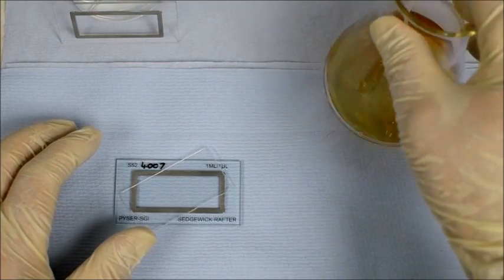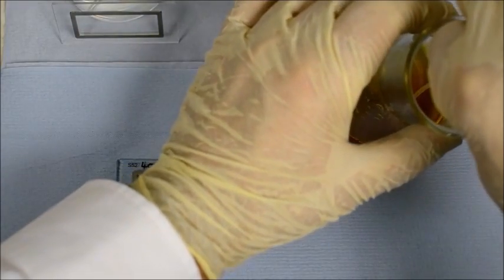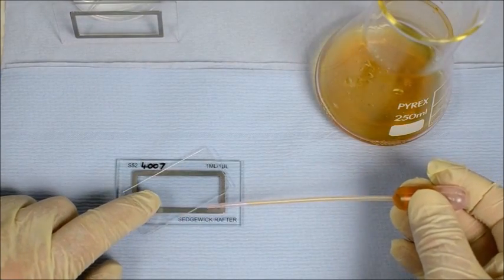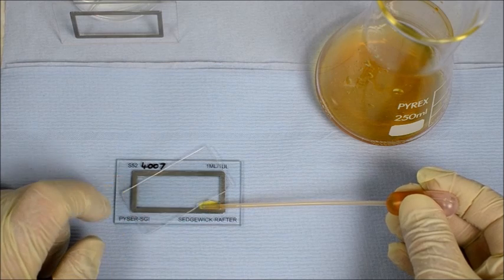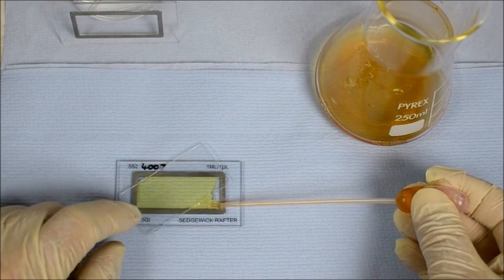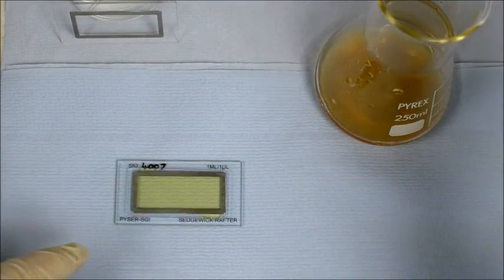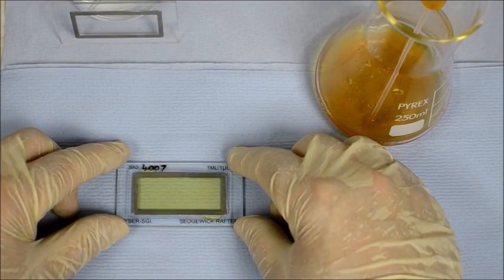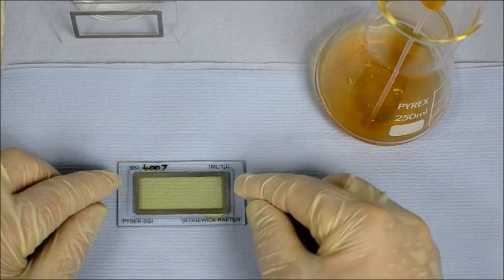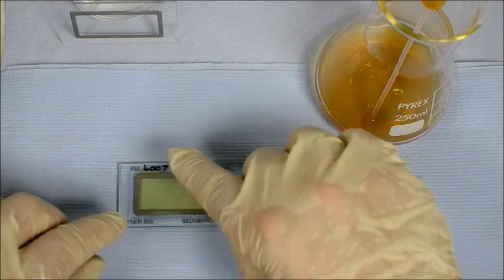With the sample well distributed and well mixed, draw at least one millilitre into a wide neck pipette. Fill from one edge, keeping the pipette nice and flat, and just fill through. Once the chamber is full, be careful not to overfill, because you don't want the cover slip to float free. You want surface tension to hold it close down onto the cell wall itself.